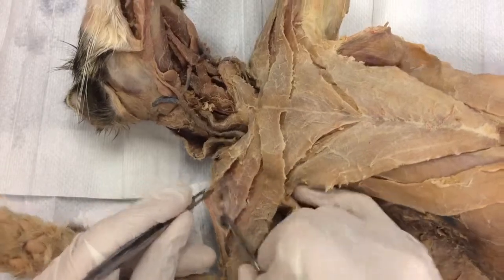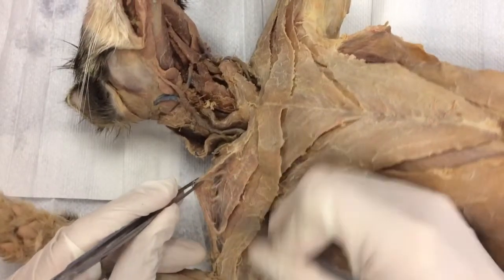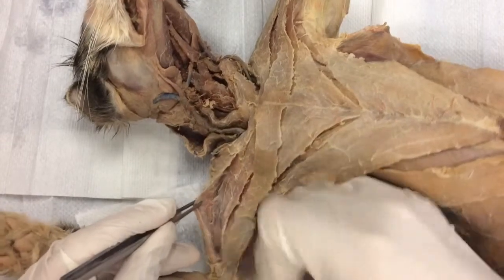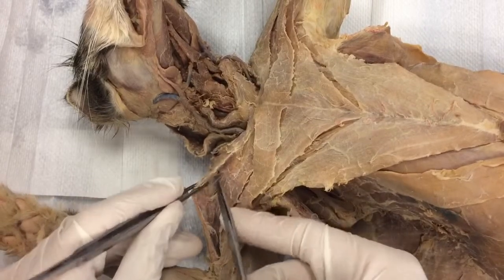I'm going to lift this up. There's all kinds of cotton candy under there — nerves and connective tissue. You can hear that noise it's making. Now if you can't get through those, just use your scissors. Baby nip.